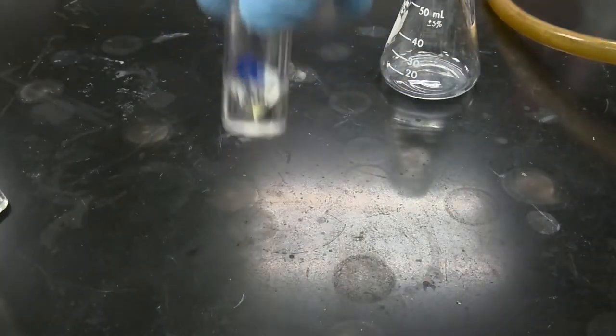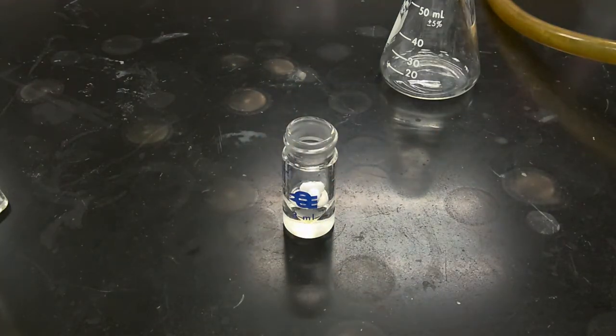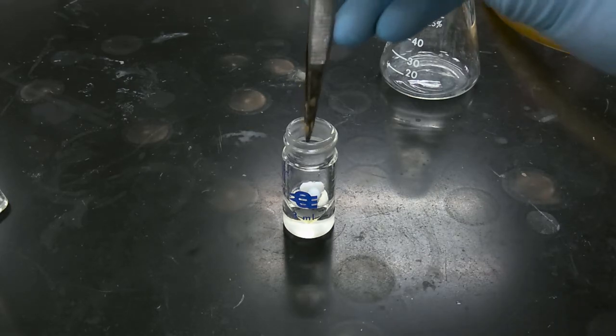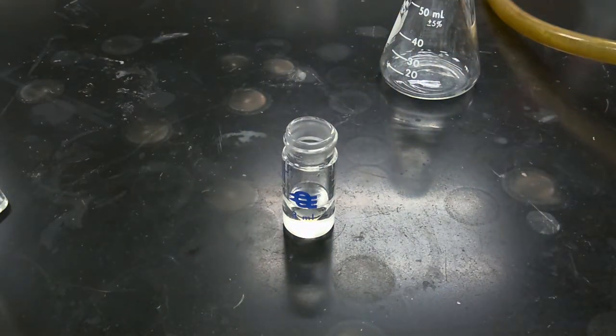Okay, so we've concentrated down our reaction mixture. So now what we're going to do is add diethyl ether, and then add sodium bicarbonate, and we're going to rinse the ether layer repeatedly with sodium bicarbonate. To facilitate this process, we're first going to remove the stir bar. Okay, so we've removed our stir bar. We're then going to add the ether, and we're going to resume when we start the quench with sodium hydrogen carbonate.